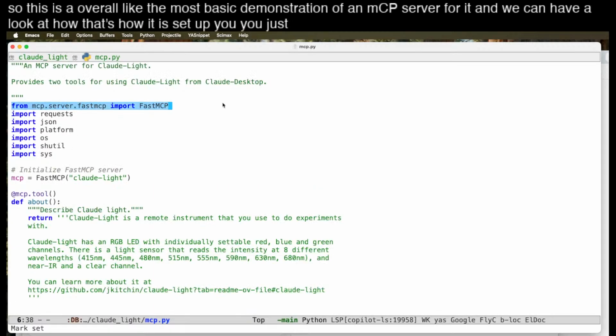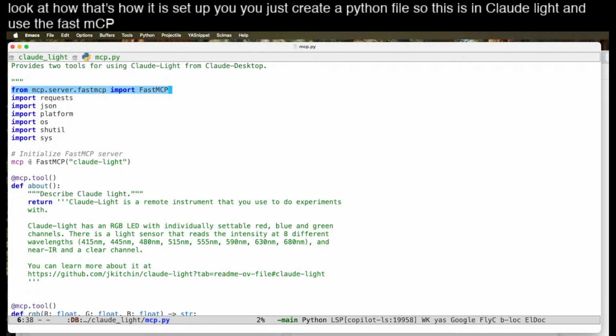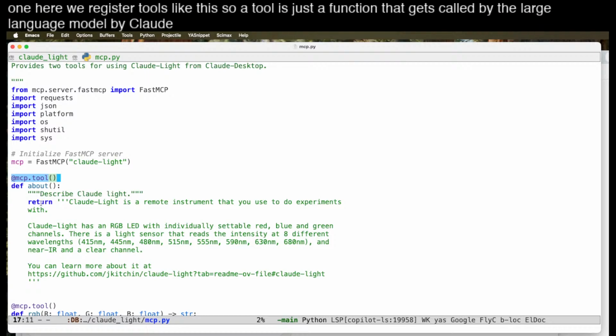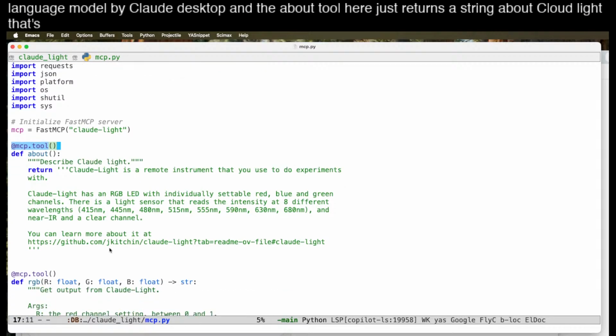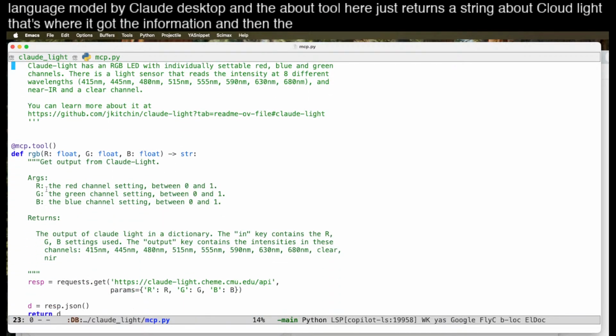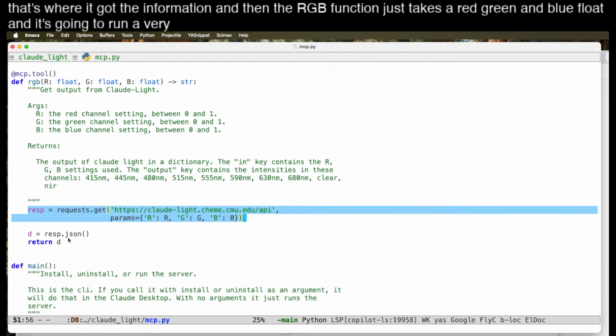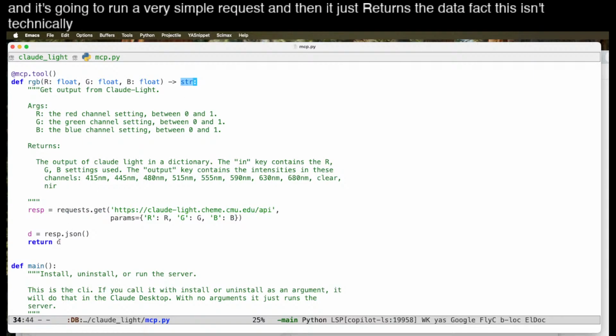You just create a Python file, so this is in Claude-Light, and use the FastMCP server. So we make one here. We register tools like this. So a tool is just a function that gets called by the large language model by Claude Desktop. And the about tool here just returns a string about Claude-Light. That's where it got the information. And then the RGB function just takes a red, green, and blue float, and it's going to run a very simple request, and then it just returns the data. In fact, this isn't technically returning a string, it just returns the data. But type annotations in Python are not super strict.